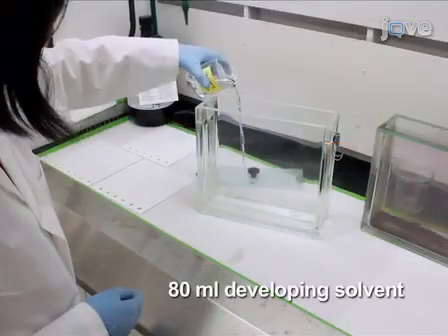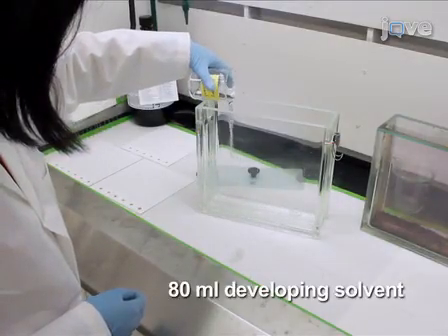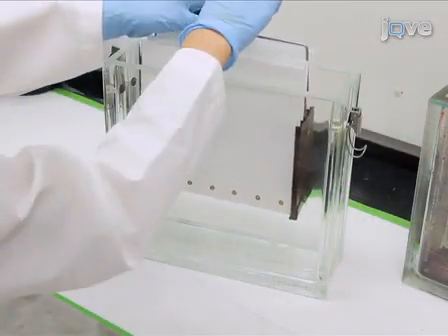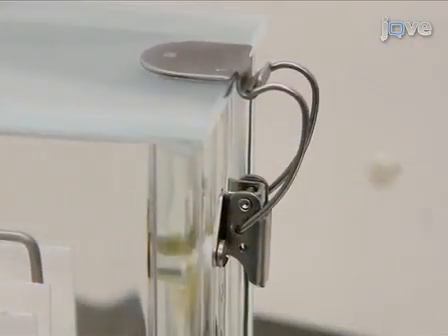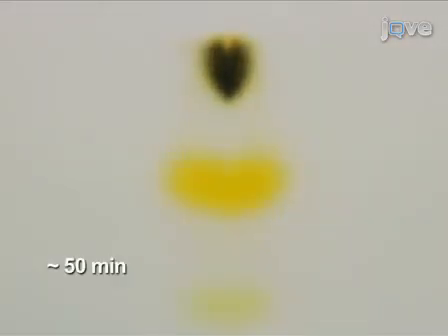Pour 80 ml of the developing solvent into a sealable TLC developing chamber and place the plate into the tank with the sample end facing down. Seal the tank using the clamp. The solvent will ascend the plate and lipids will be separated. The development time is approximately 50 minutes at room temperature.